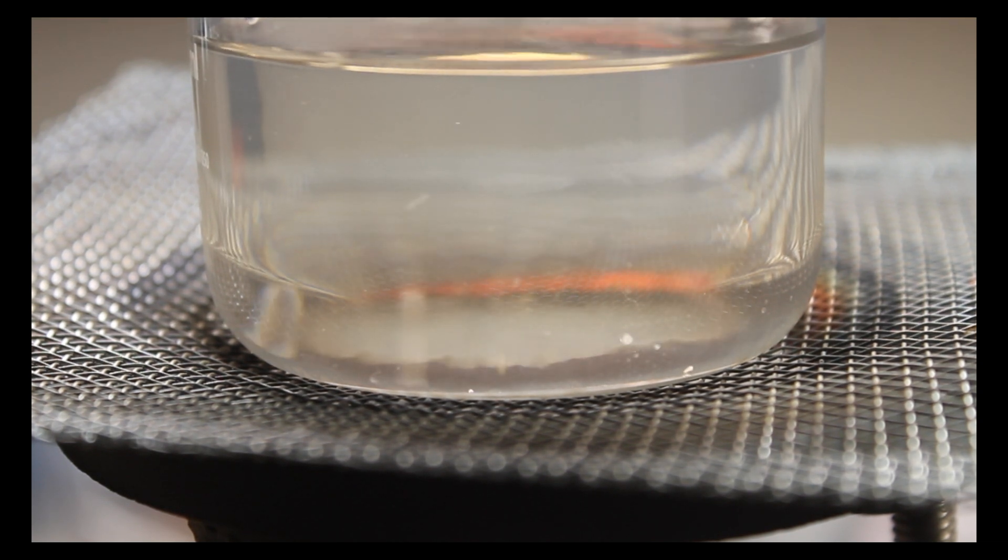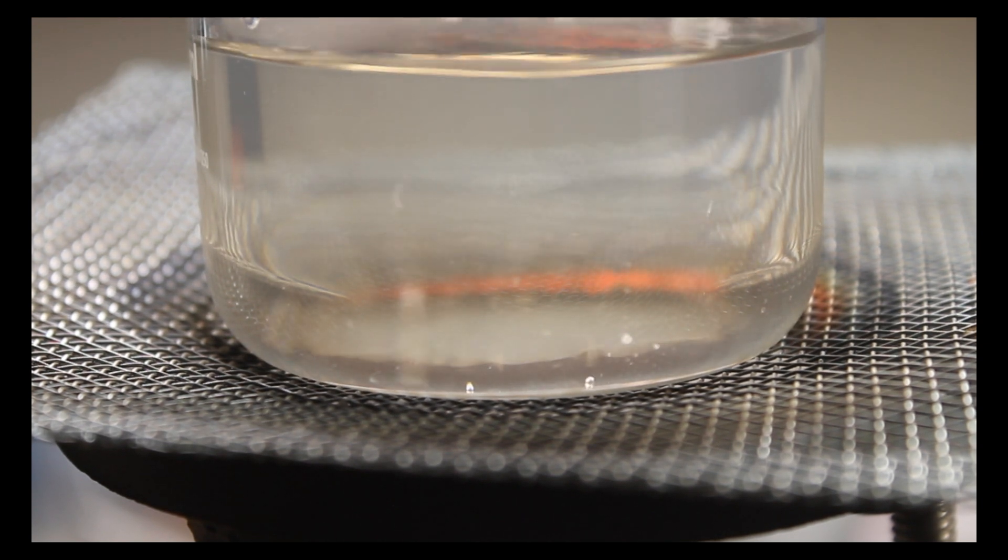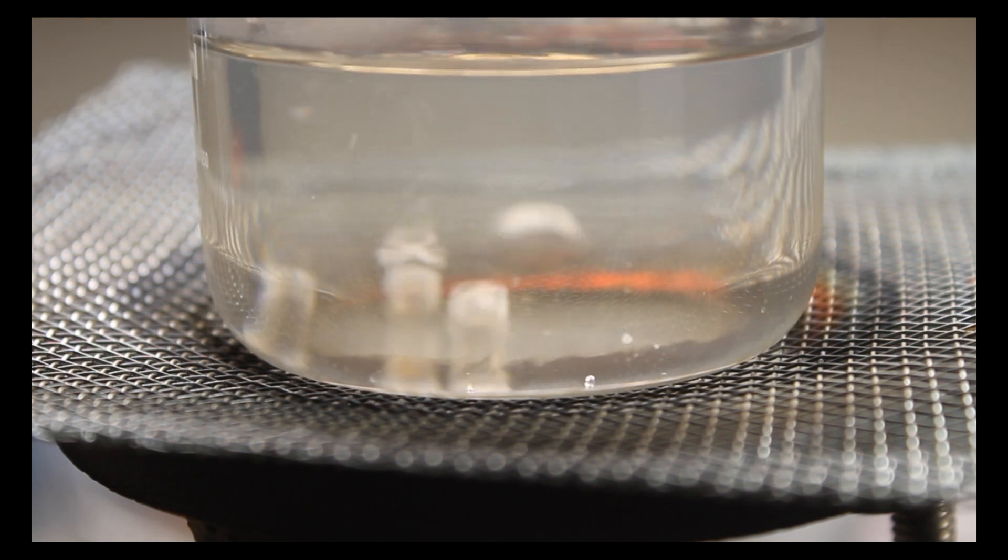Inside of this beaker, we have a saturated solution of sodium chloride, better known as table salt, which has been dissolved into water.